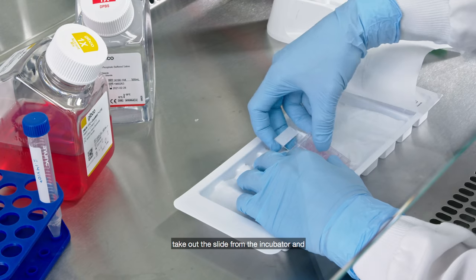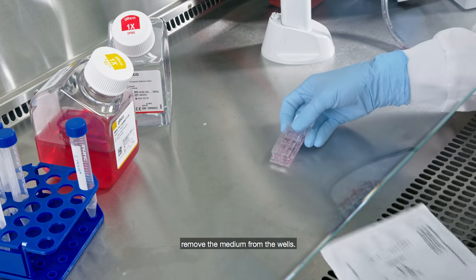Once incubation is complete, take out the slide from the incubator and remove the medium from the wells.